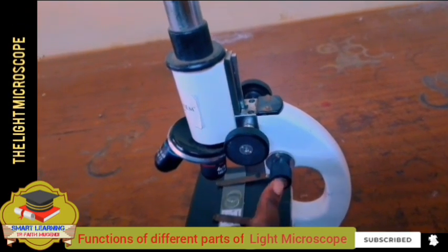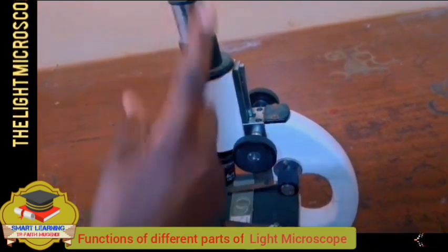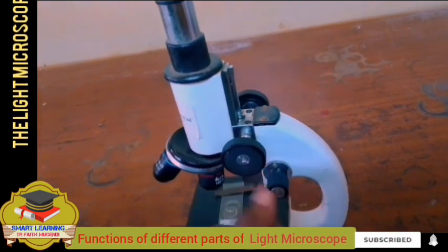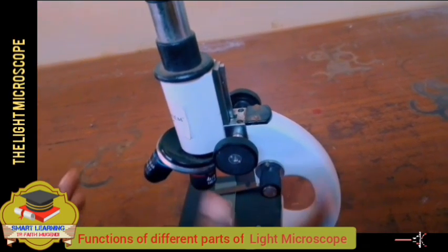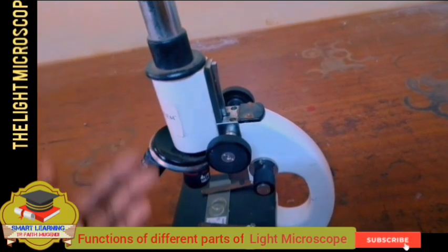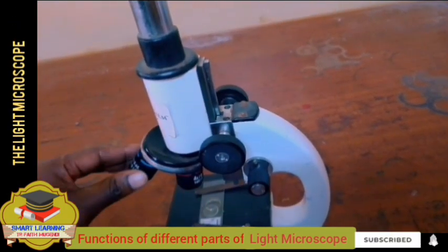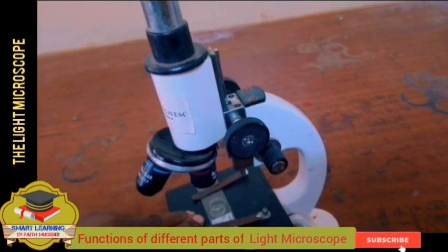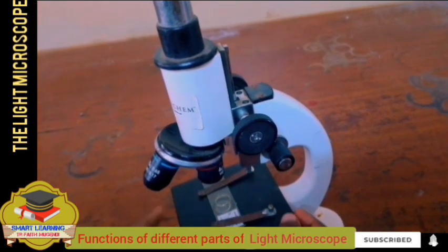The fine adjustment knob just moves the body tube slightly, such that you cannot even tell whether it is moving, but they both move the body tube up and down. In simple terms, they bring the objectives nearer the specimen or away from the specimen.